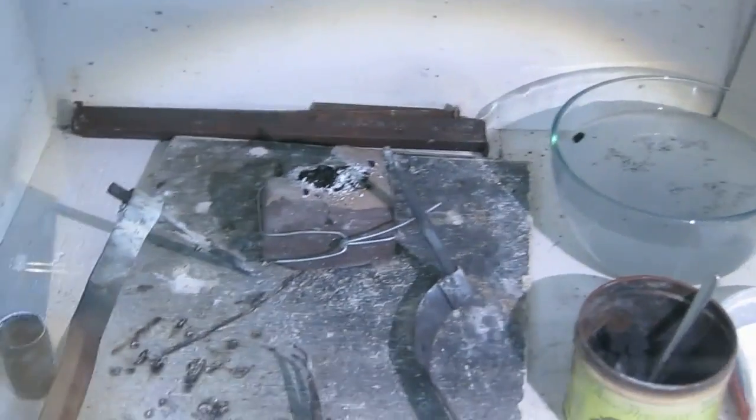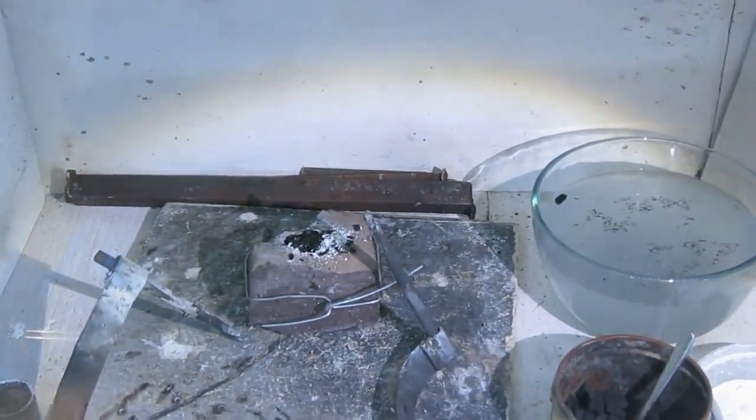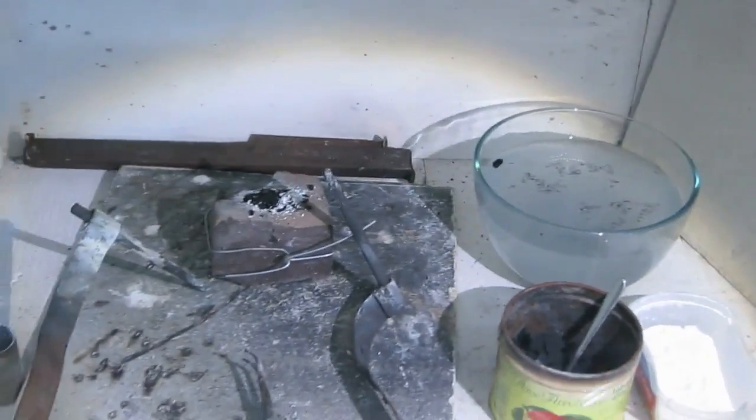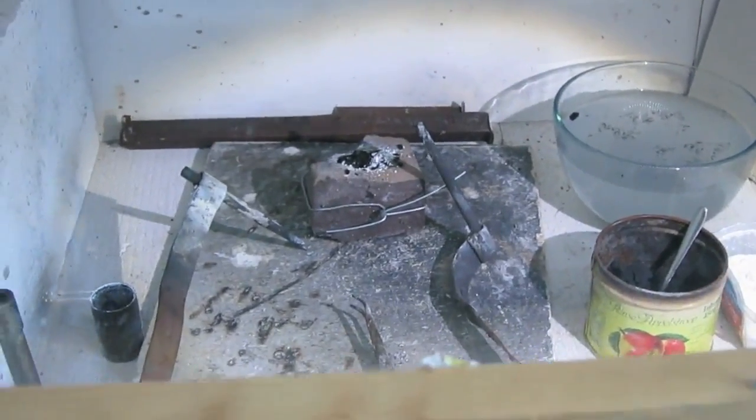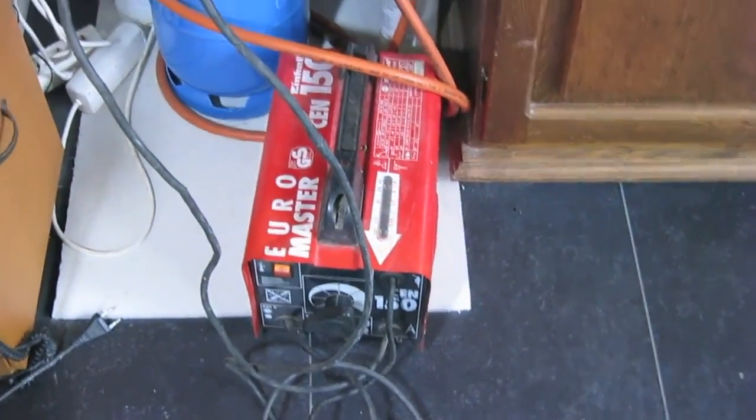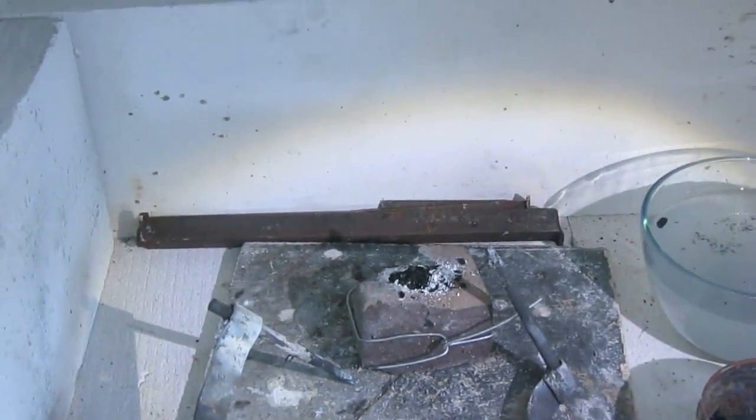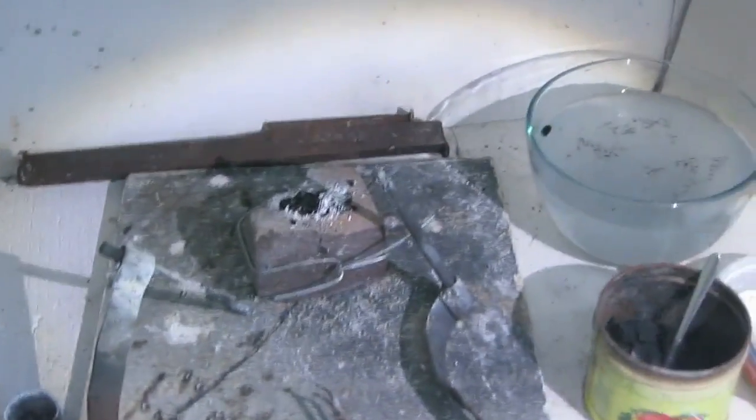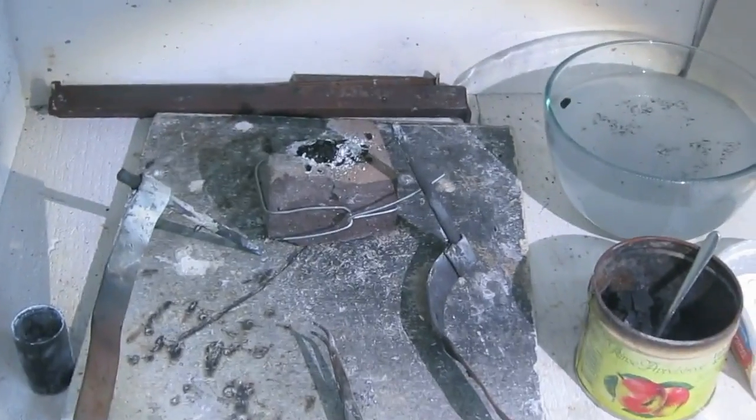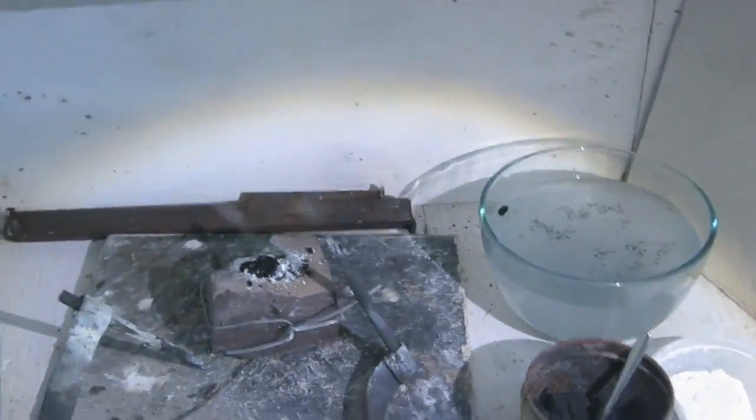I'm going to accomplish this temperature the same as it's done commercially by an electric arc heater, which I'm using now, a cheap hardware store grade welder which generates a current of 80 to 100 amps at a voltage of about 20 volts. And this will generate a very hot electric arc which is enough to generate the CaC2 from the CaO and the charcoal.